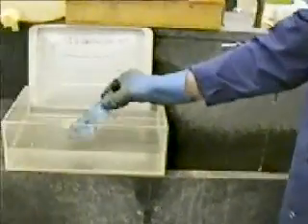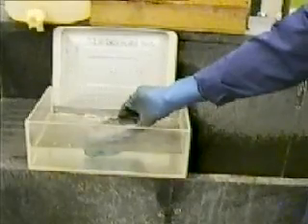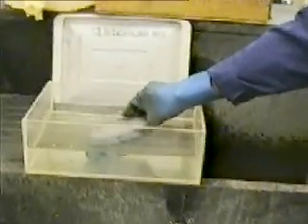After segments have been cut they may be prepared for chemical etching. First a stream of tap water cleans the cut surface, and then the coal ball segment is immersed in a bath of 5% hydrochloric acid for 15 seconds. This etches away the carbonates, which are released as carbon dioxide bubbles. The acid is then washed off the block.